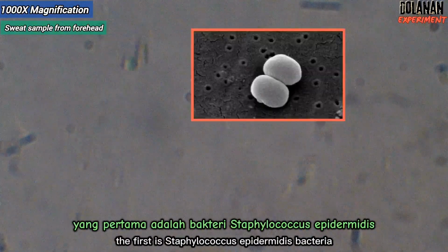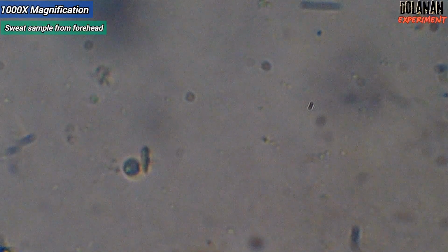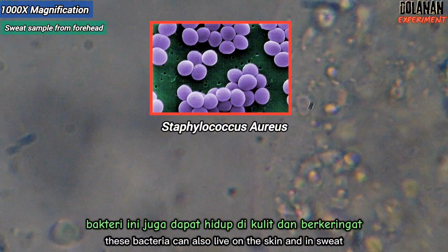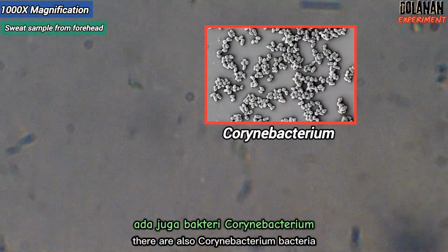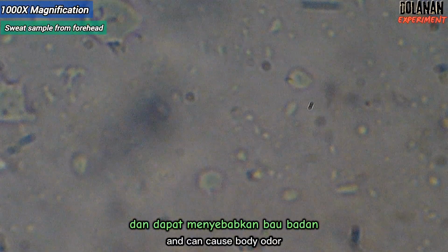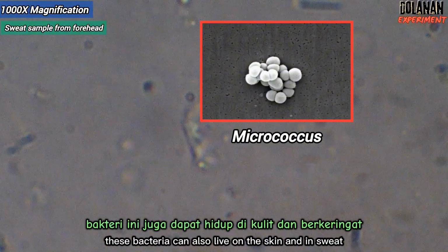The first is Staphylococcus epidermidis bacteria. These bacteria generally live on human skin and can be found in sweat. Next, there are Staphylococcus aureus bacteria. These bacteria can also live on the skin and in sweat, and can cause skin infections. There are also Corynebacterium bacteria. These bacteria can live on the skin and in sweat, and can cause body odor. And the last is Micrococcus bacteria. These bacteria can also live on the skin and in sweat.